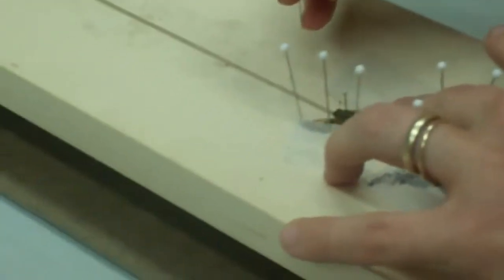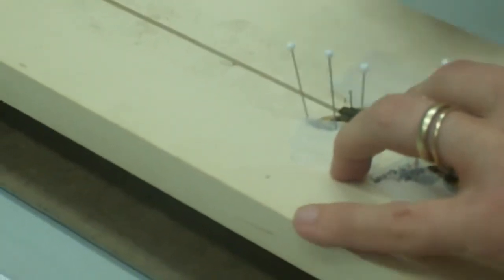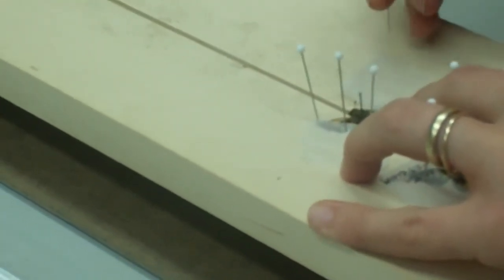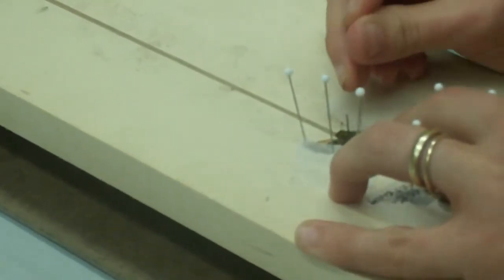And I always do the left side first and then the right side because I'm right-handed. Makes sense. And if I do the right side first, then I bump into the pins when I'm trying to position the left side.